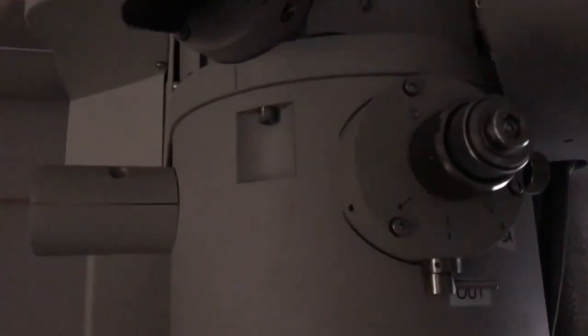Now what I need to do is take out the objective aperture. That's important because remember what the objective aperture does: it limits the portion of the diffraction pattern that ultimately contributes to the image. So if I leave it in, I'm not seeing all of the diffraction pattern. I'm going to take it out now because I don't need it in anymore. It's probably a little hard to see, but I can see more of the diffraction pattern now. So I'm going to head back into image mode here.